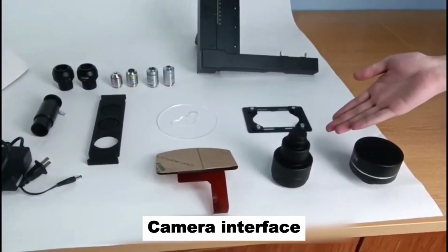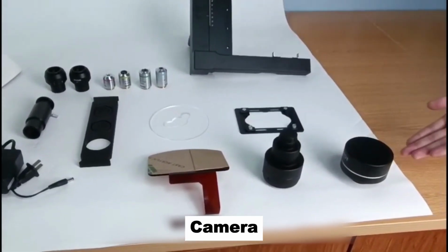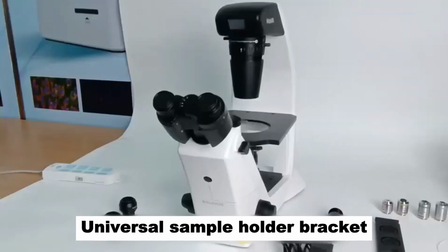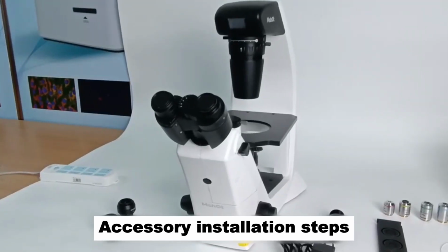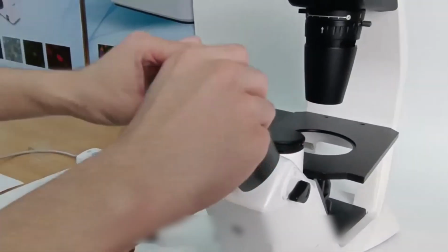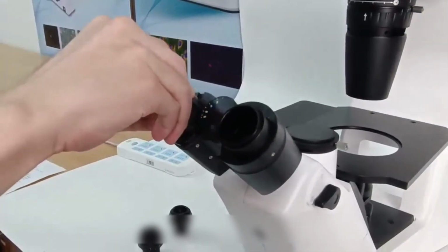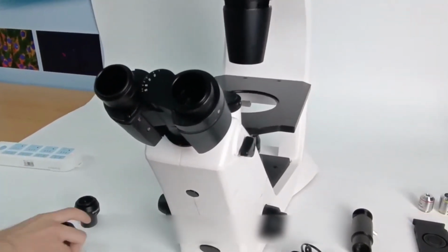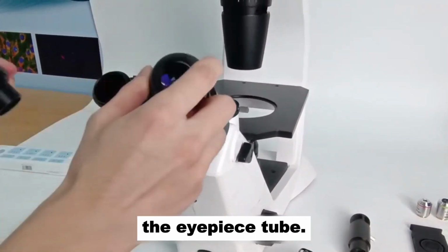Camera interface. Camera. Universal sample holder bracket, accessory installation steps. Remove the dust cover of the eyepiece tube. Insert the eyepiece into the eyepiece tube.